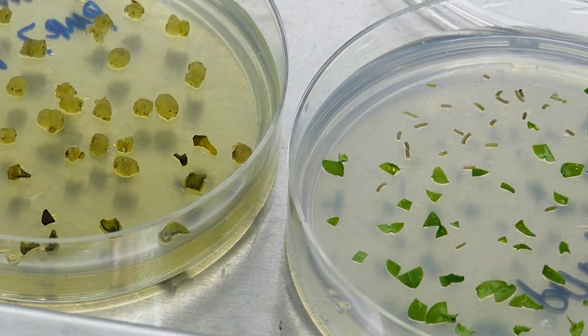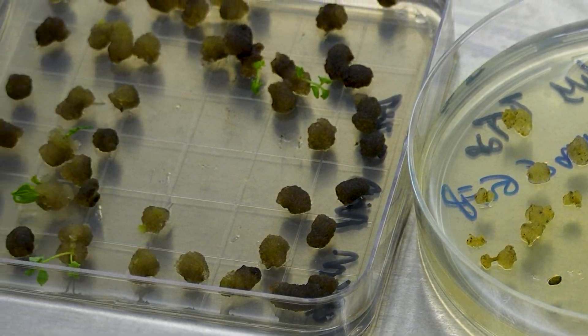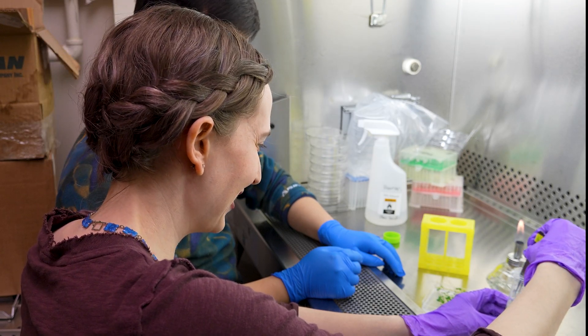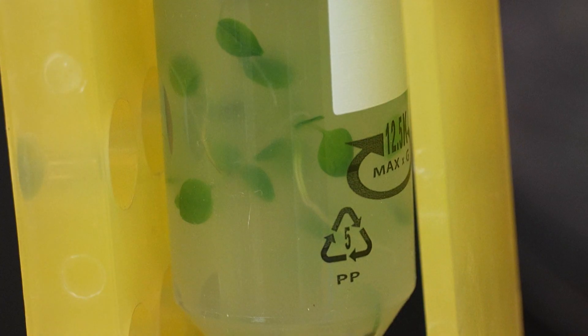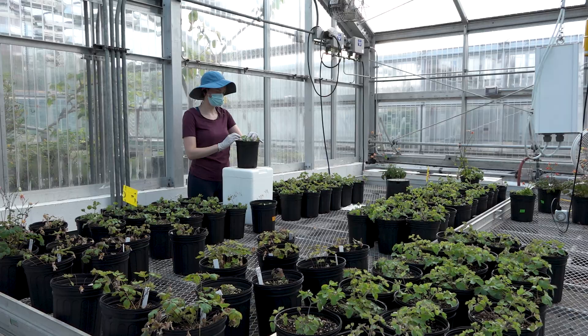It was super helpful to see all the stages laid out together like a science cooking show, but I really wanted to know how the plants that Yan and I transformed together turned out. Most importantly, are they going to glow green from the GFP gene we added? I'd been waiting nine years to transform columbine, so I had to come back a few weeks later to see the results with my own eyes.